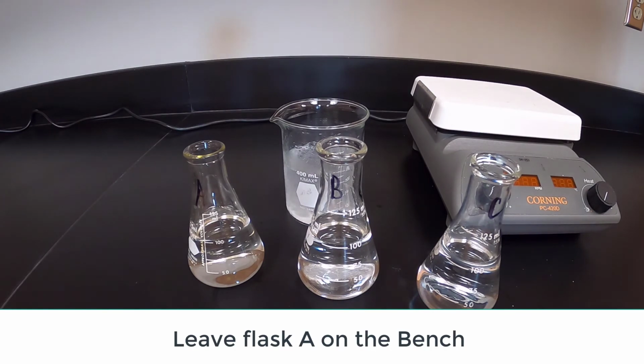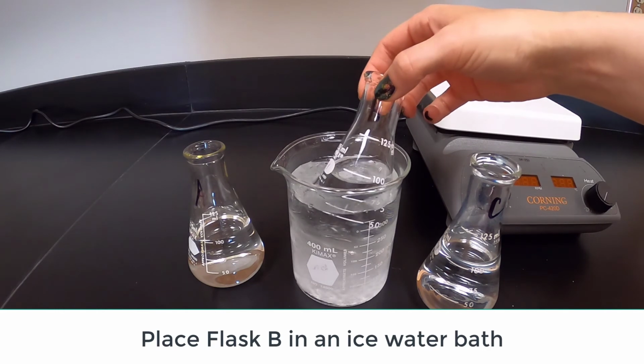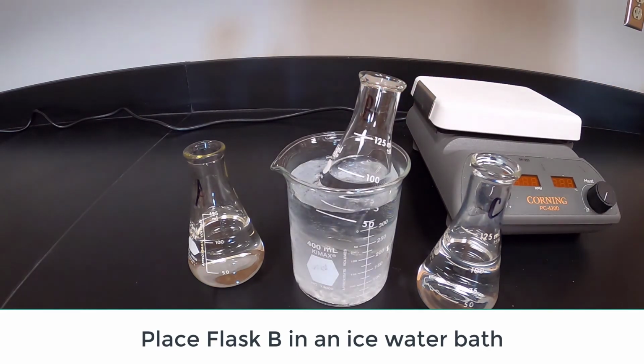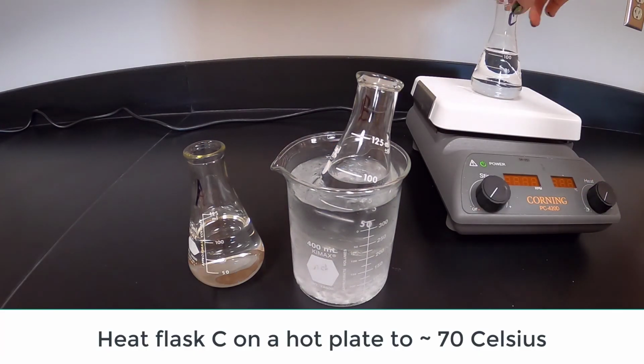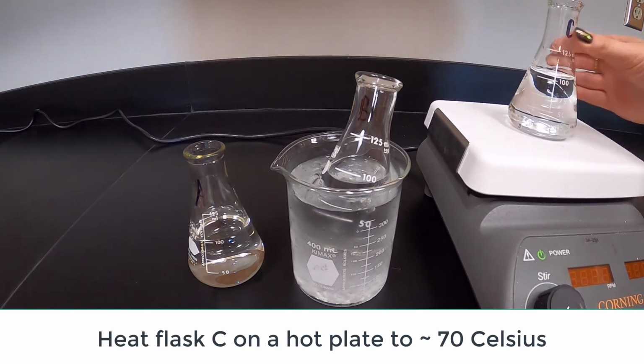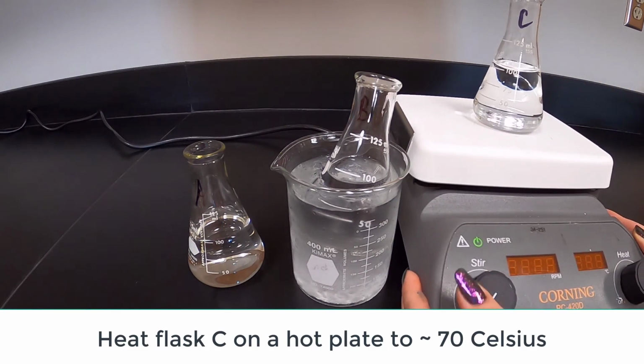Leave flask A on the benchtop. Insert flask B into an ice water bath. Heat flask C on a hot plate until the water temperature is about 70 degrees Celsius.